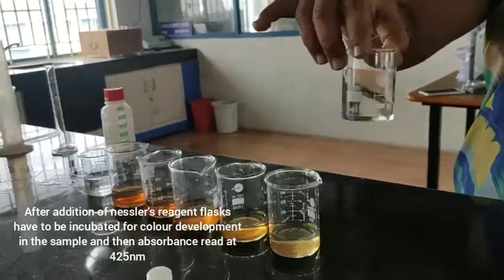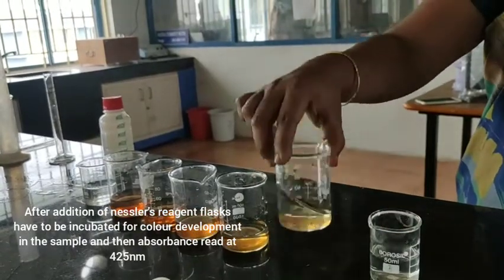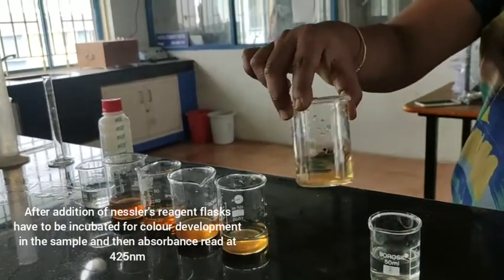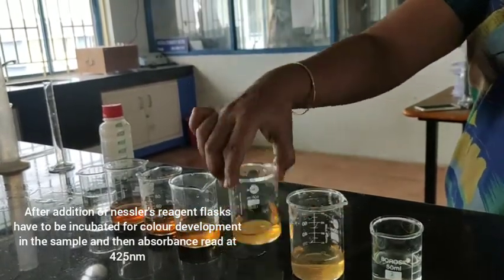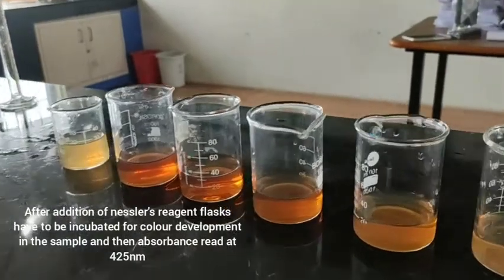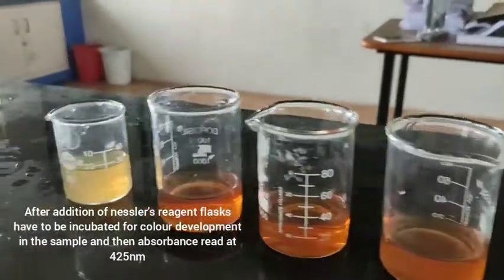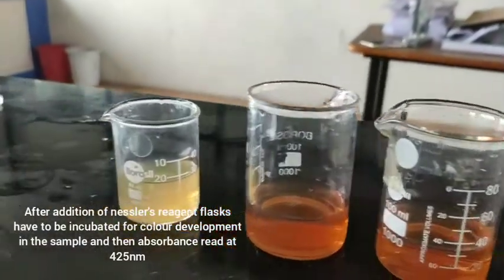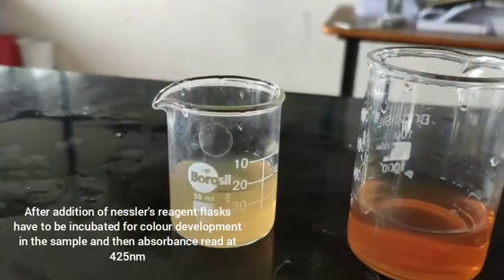We have to mix well and incubate for colour development. After incubation, the colour development can be observed across the flasks.